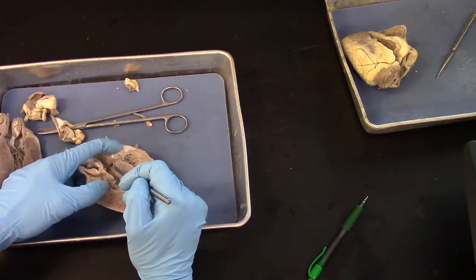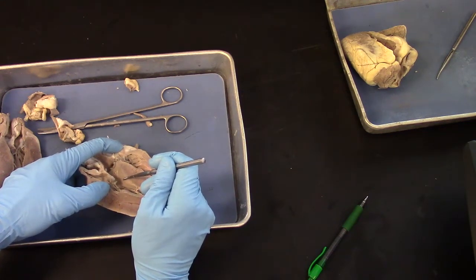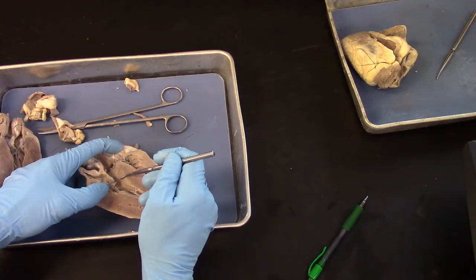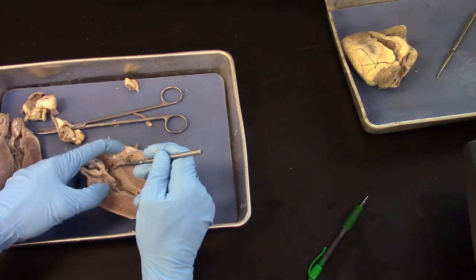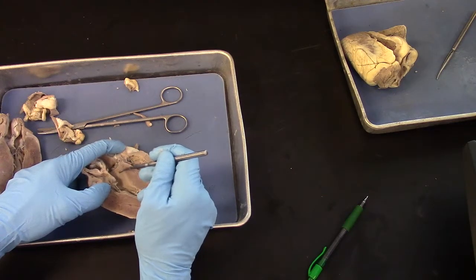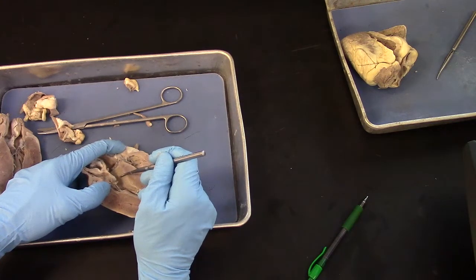And interestingly, when the ventricle is in systole and blood is leaving the left ventricle, the valve has to open to let blood flow out, and as it opens, it covers up the coronary artery so that blood doesn't get forced into the artery during systole.